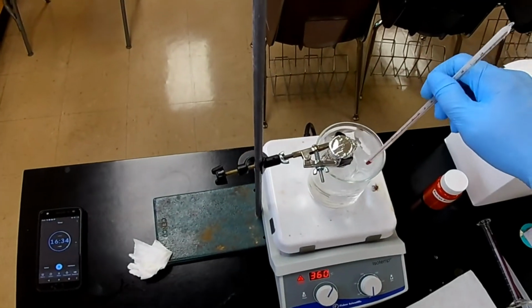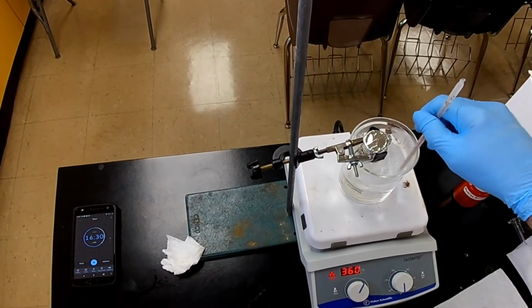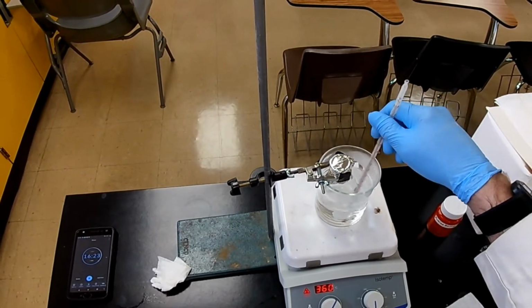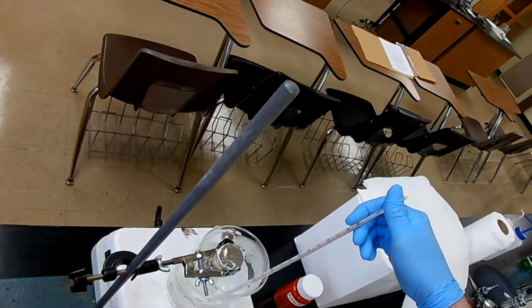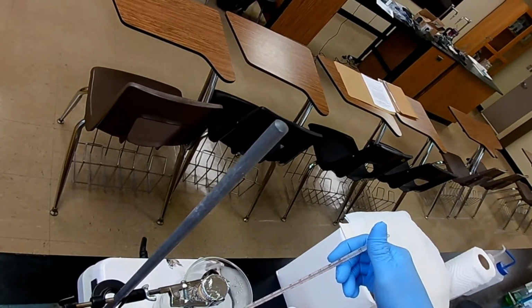Let's start measuring the temperature, so when the minute's up, we'll be able to pull it out with a temperature. Temperature of the gas is the temperature of the boiling water bath. It's on its way, 97, okay.